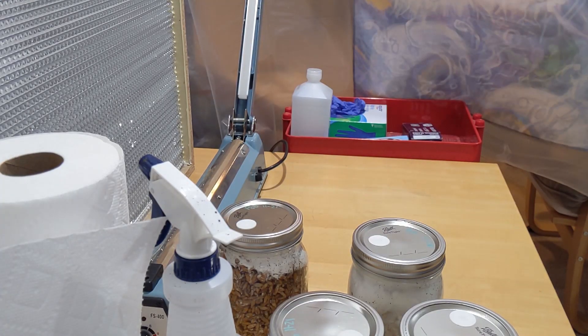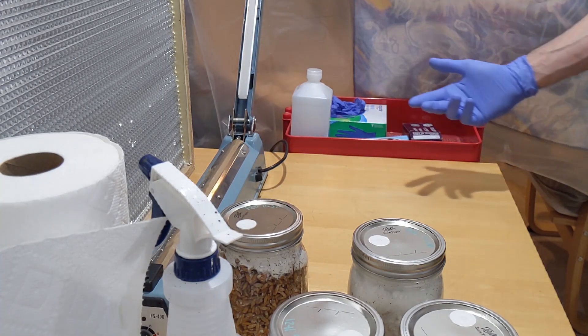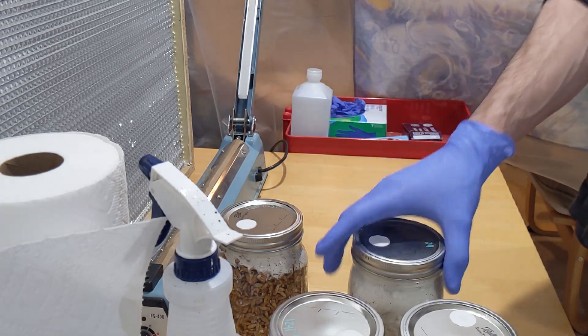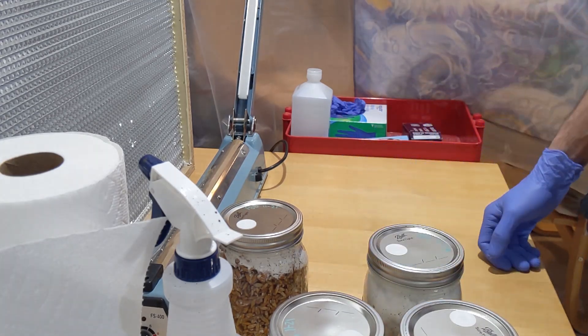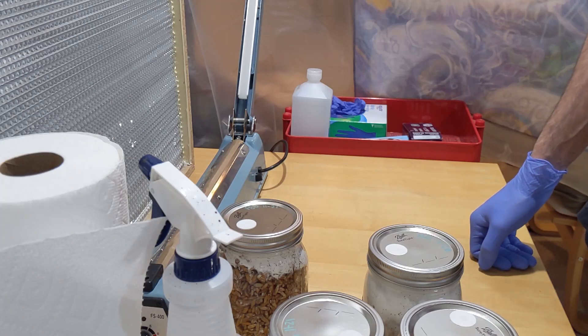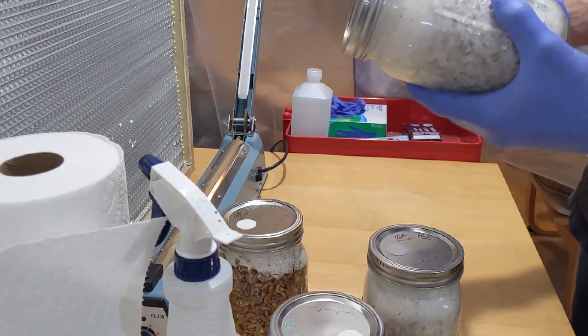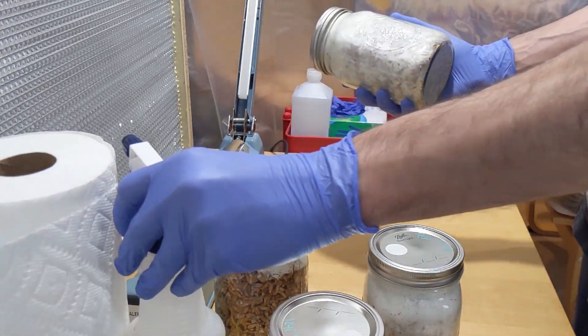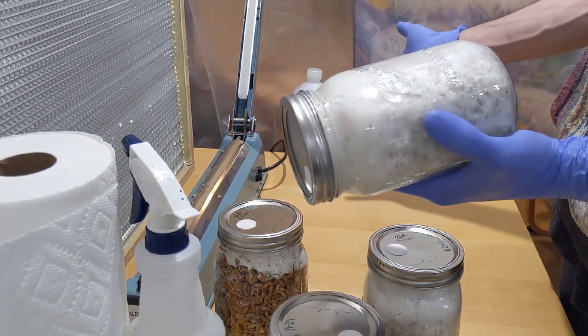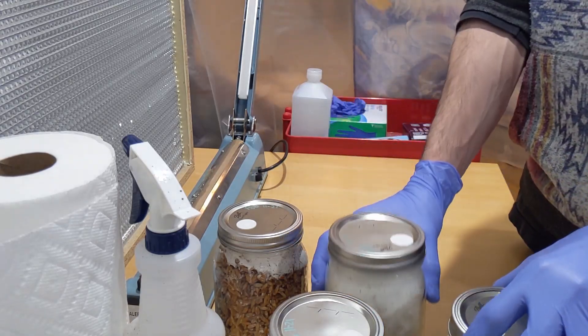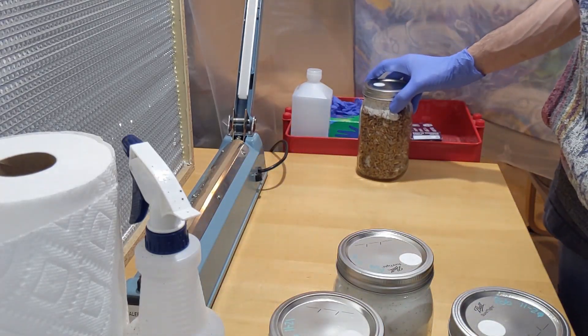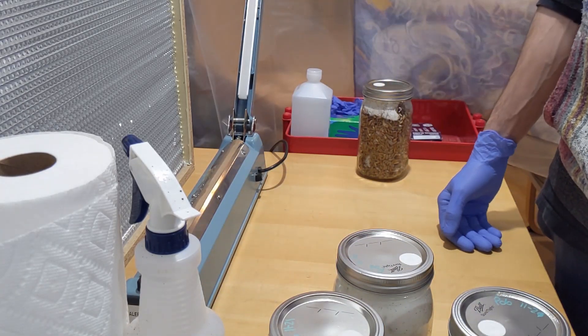What's up guys, just shooting a quick video. I guess I'm not sure, this might be part of the full growth series, but I inoculated some grains about a week ago, these are some blue oysters, and I just got some substrate ready so we're gonna inoculate the substrate.